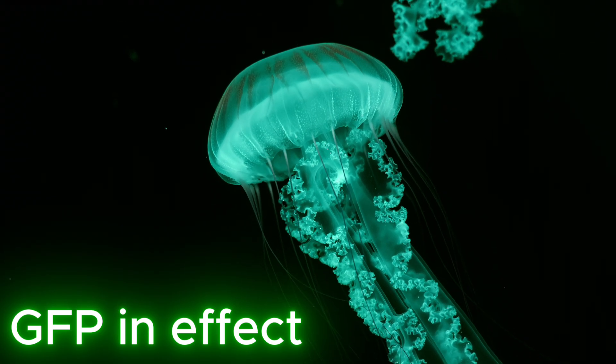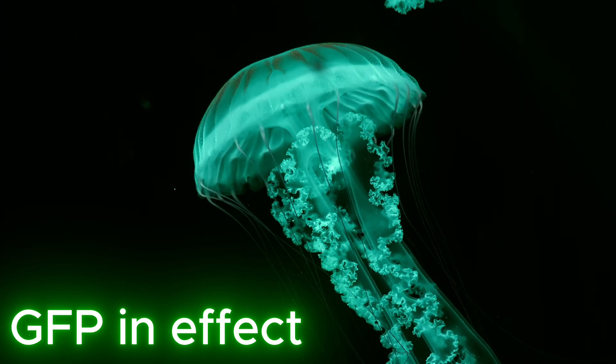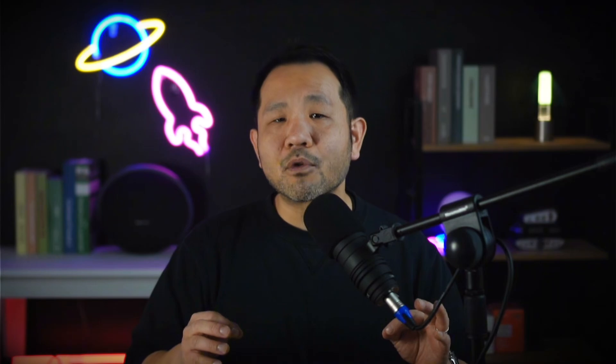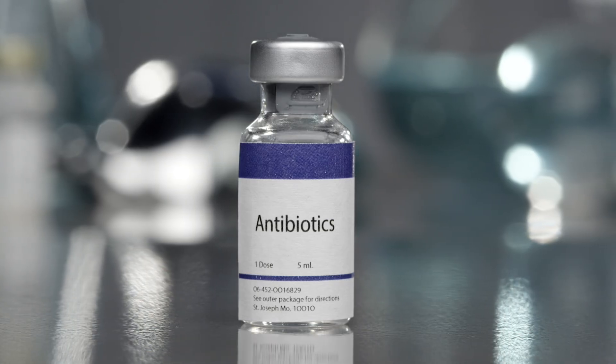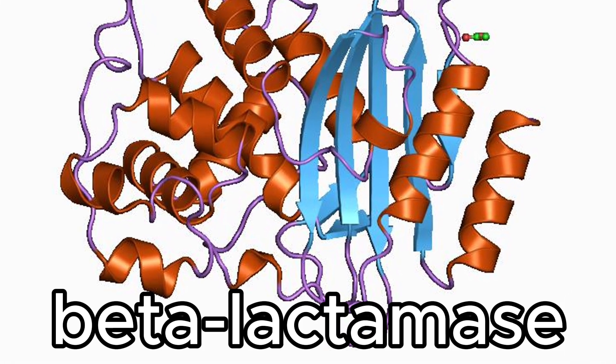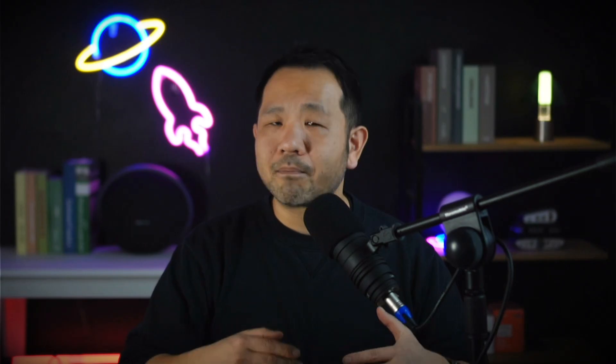GFP is where this plasmid gets its name from. The GFP gene produces a green fluorescent protein that fluoresces green under UV radiation. The plasmid also contains the AMP-R gene, which we should take a closer look at. AMP comes from the word ampicillin, which is an antibiotic that inhibits the growth of or simply kills bacterial cells altogether. The AMP-R gene, however, encodes for a protein called beta-lactamase, which has the capacity to inhibit the actions of ampicillin. We can reasonably assume that bacterial cells with this plasmid should be able to grow on plates containing the antibiotic ampicillin — keep this in mind for later.